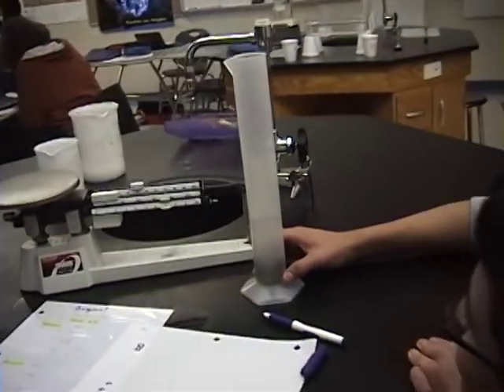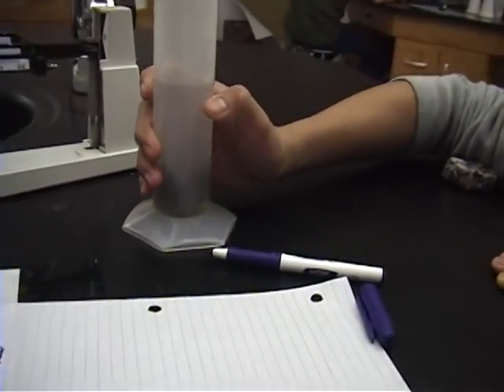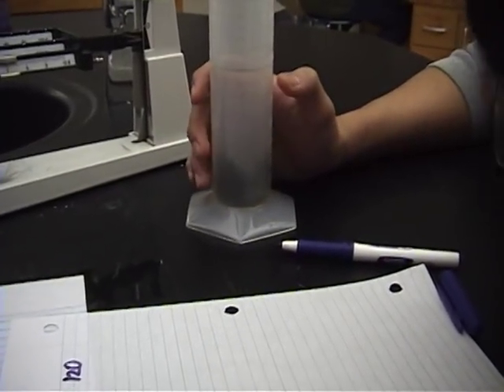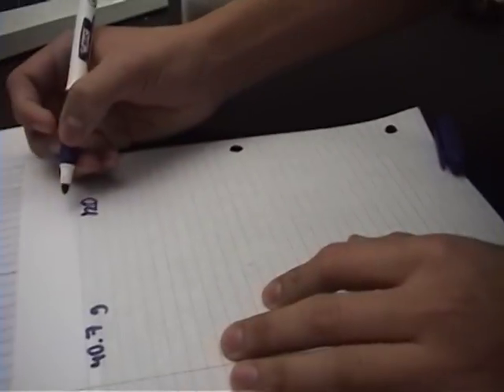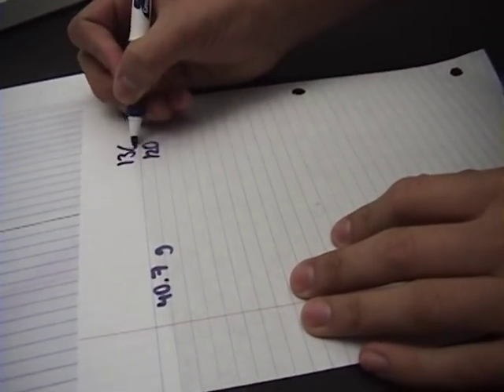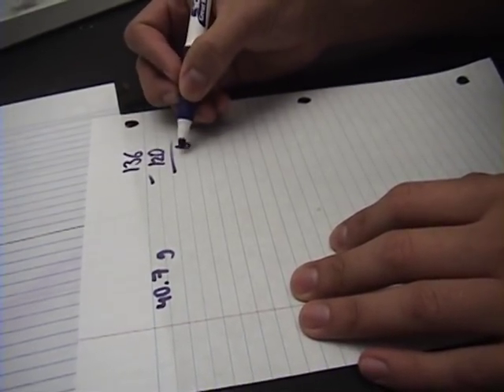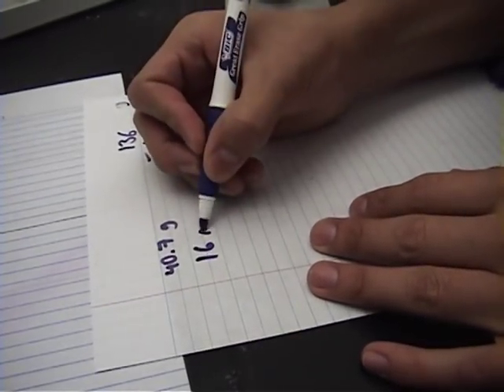And then you look at the measurement. Right now it's 120, no. It's 130, wait. 120, 130... 136. It's 136. I think. So you subtract 136 minus 120. That's 6. That's 1. And that's 0. So it's 16 milliliters.